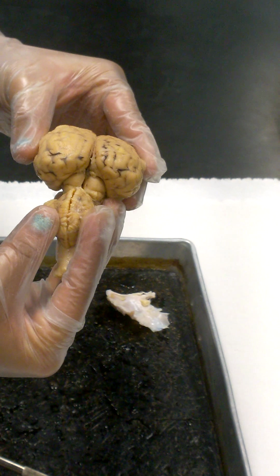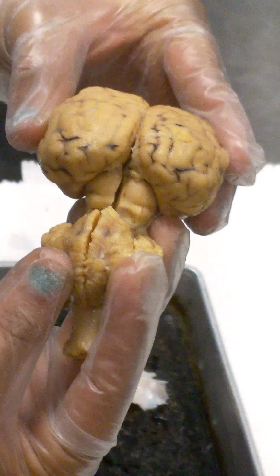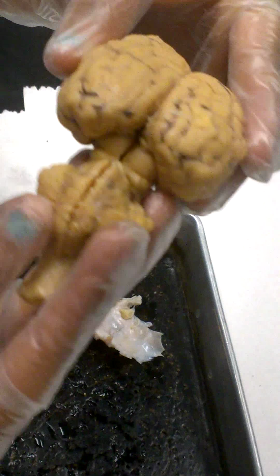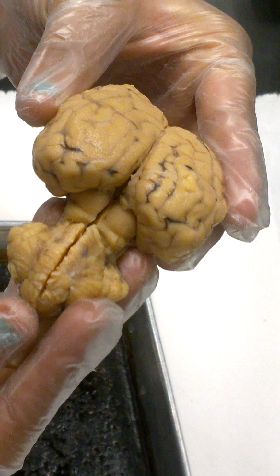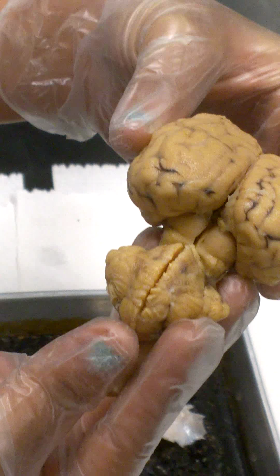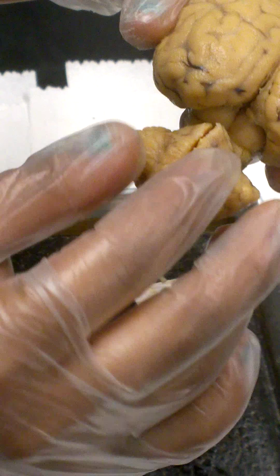Inside there, you should see something mooning you right now, like butt cheeks, basically. Two bigger butt cheeks on top and two smaller ones on the bottom. So that makes a total of four. The whole thing as a whole is called the corpora quadrigemina. The two larger ones on top are the superior colliculi. The two on the bottom represent the inferior colliculi.